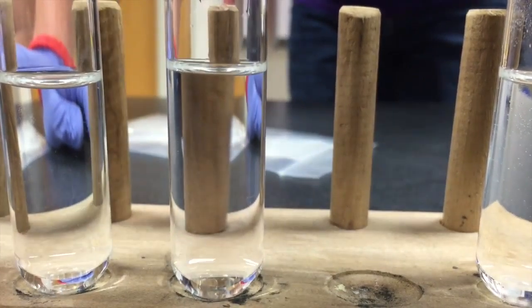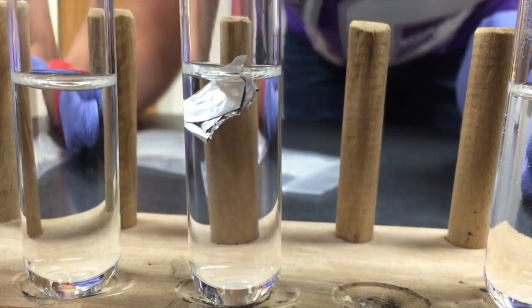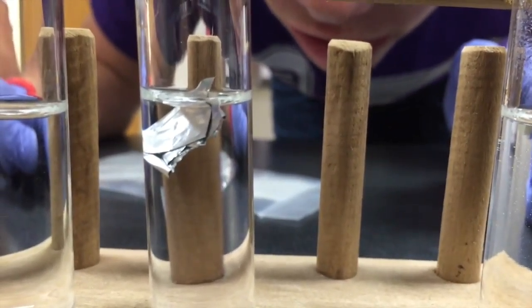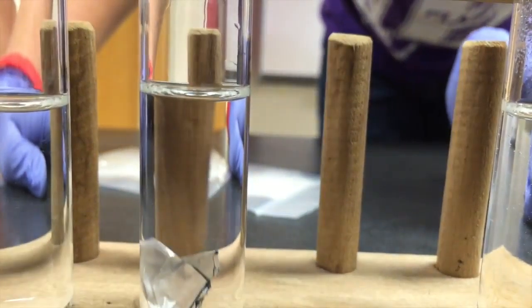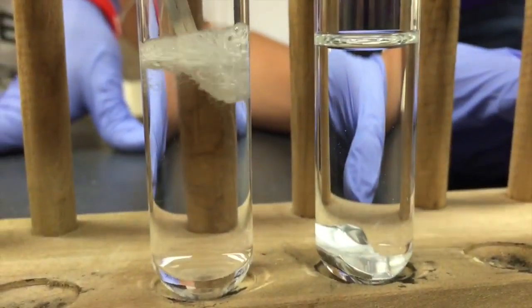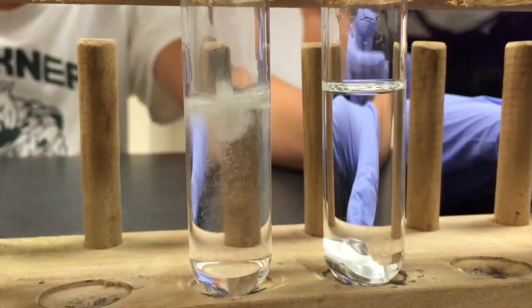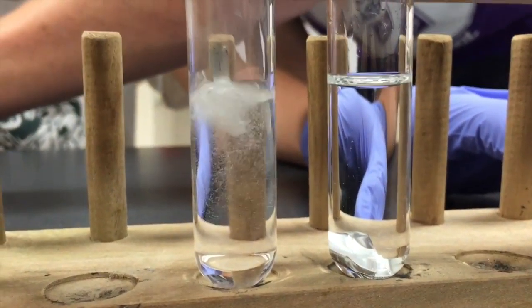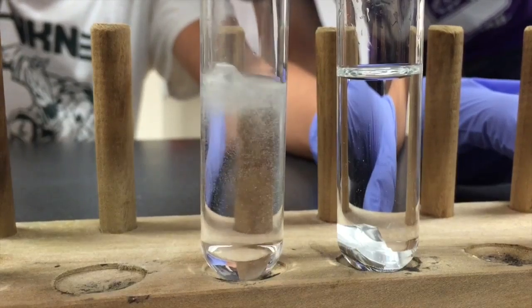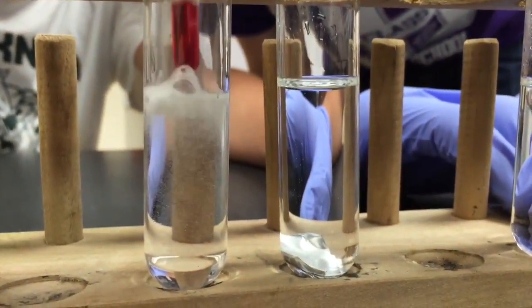After we tested the calcium, we tested the aluminum to see what would happen. As you can see, at first the aluminum doesn't react with the hydrochloric acid, so we'll just come back to it later. Anyways, let's move on to the magnesium. As we can see, as soon as the magnesium hit the acid, it started to react instantly. This reaction is very exothermic and it creates a lot of heat in the test tube. And the gas coming from this reaction is just hydrogen gas.